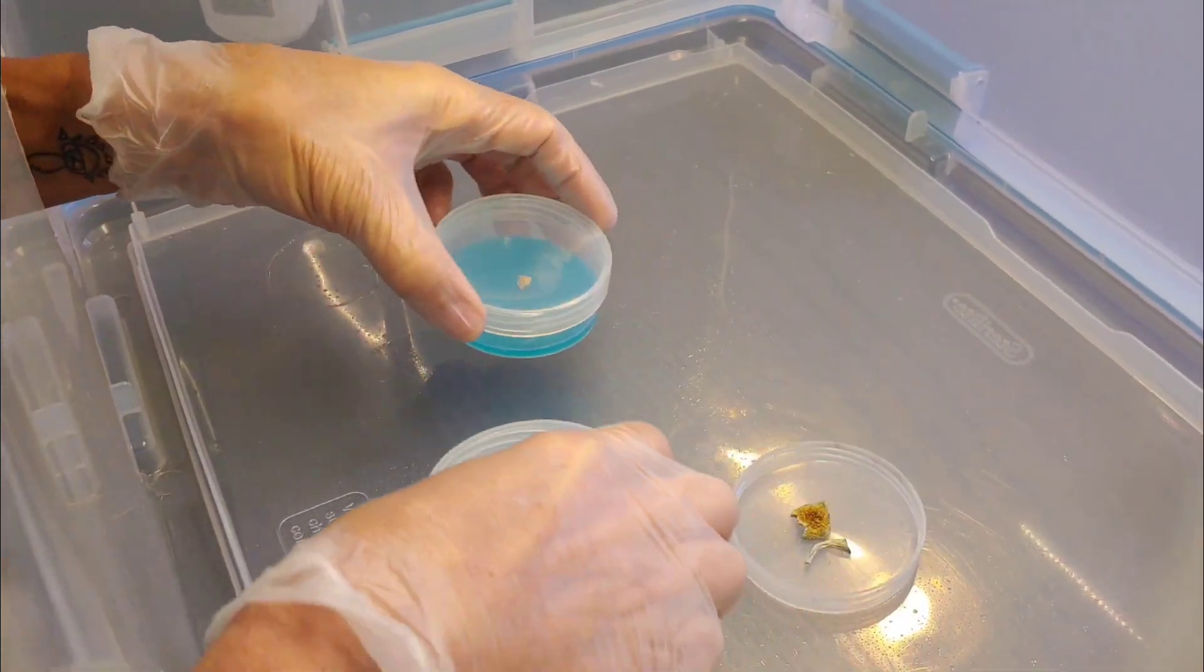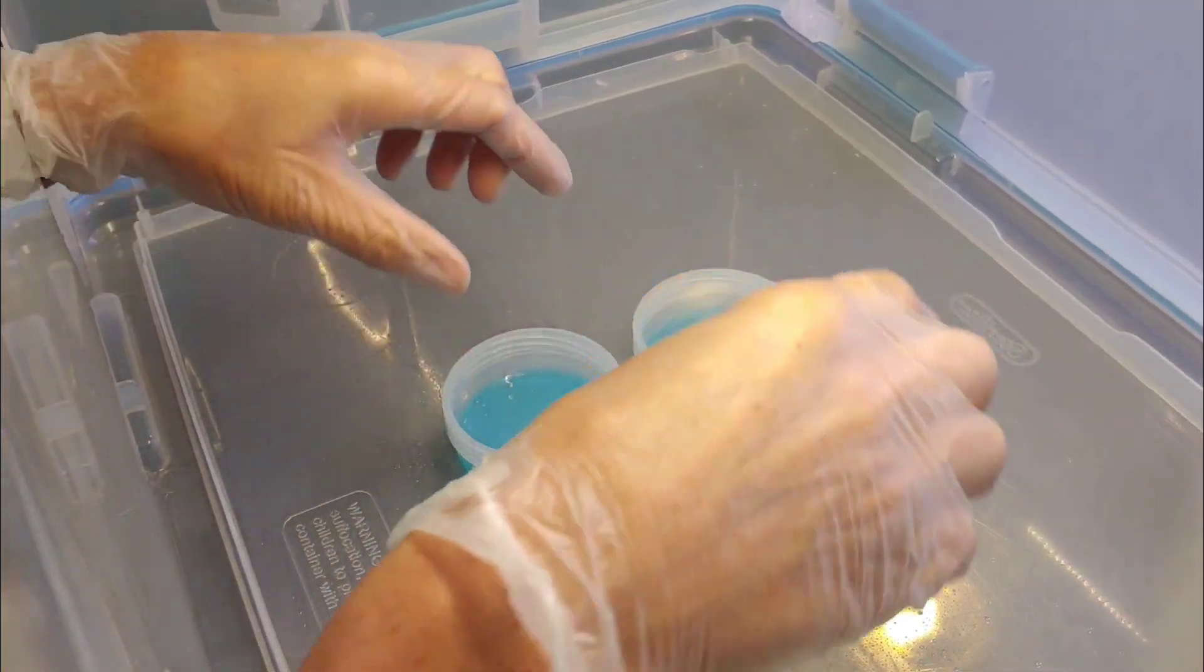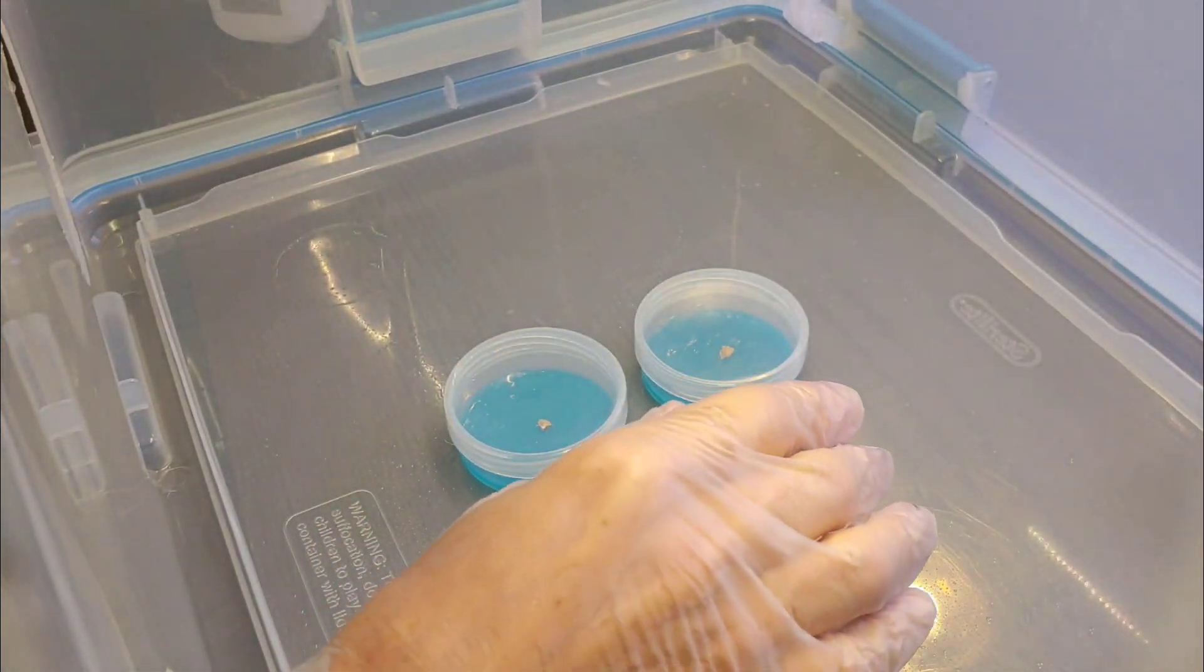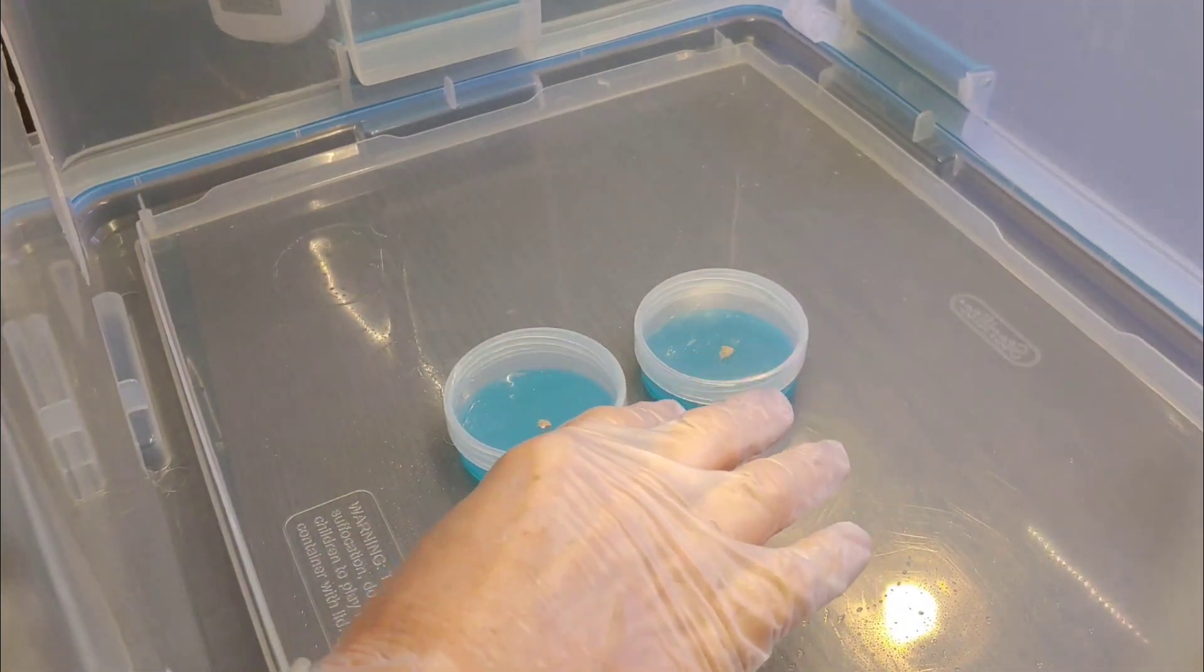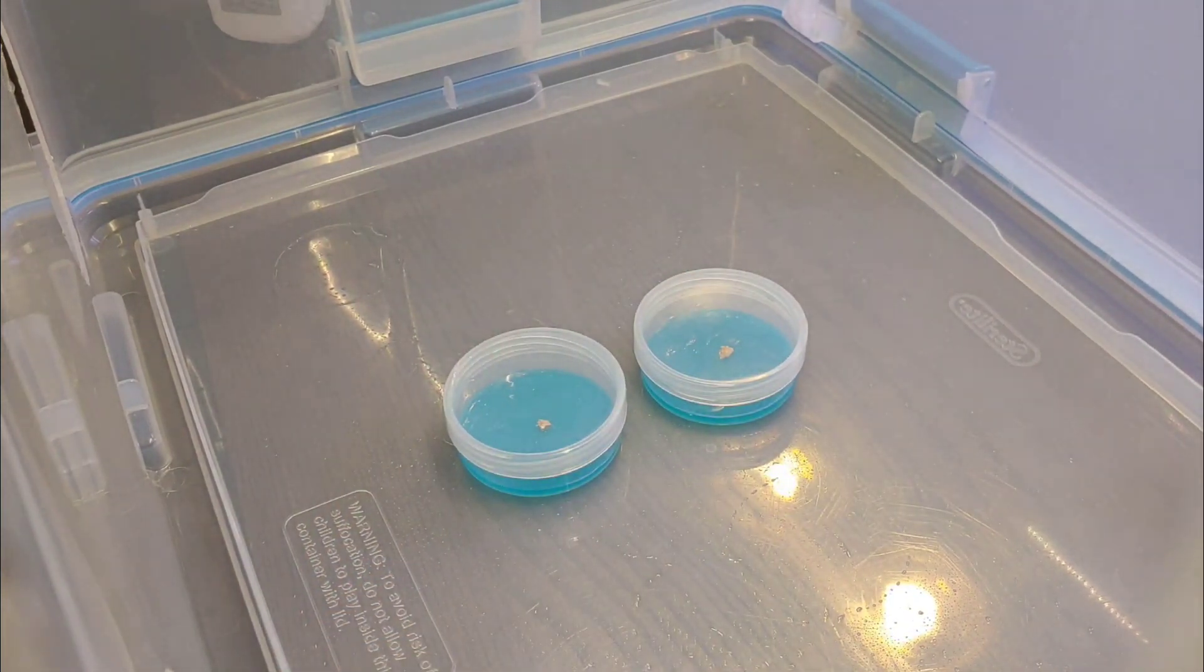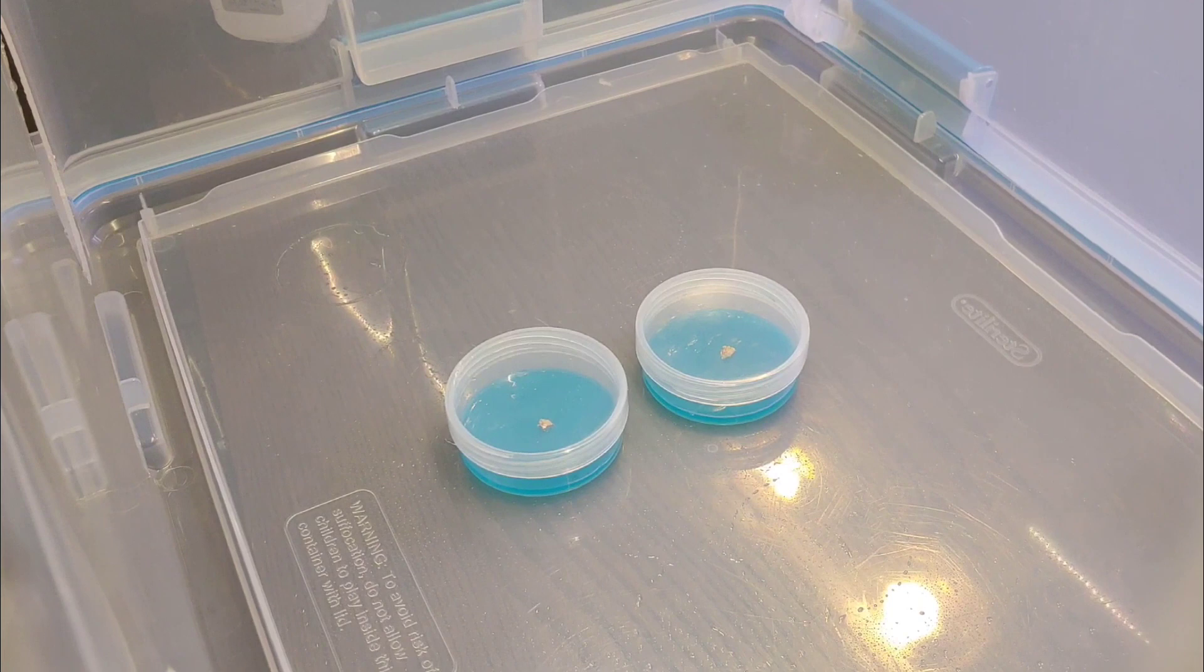Another thing is that these two agar plates have been sitting around for a bit. So I don't know, they may be iffy. So this is an experiment in a few different fronts.